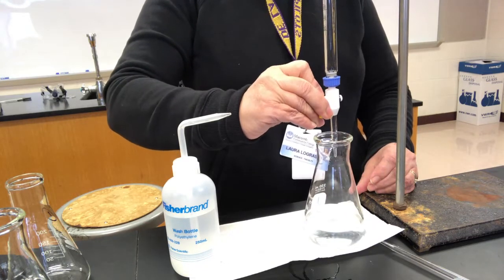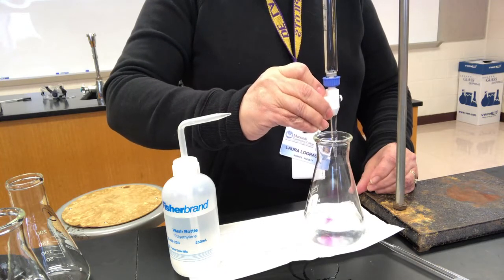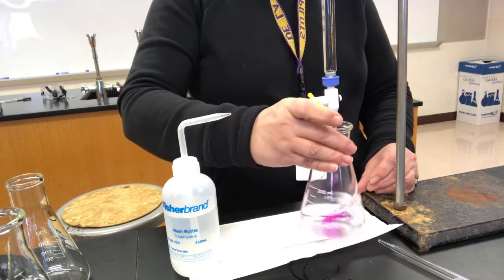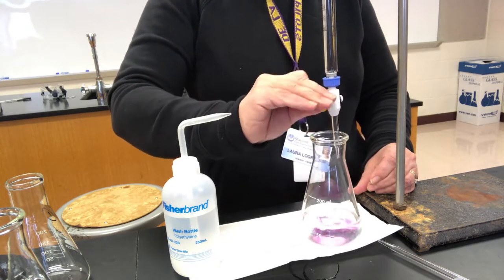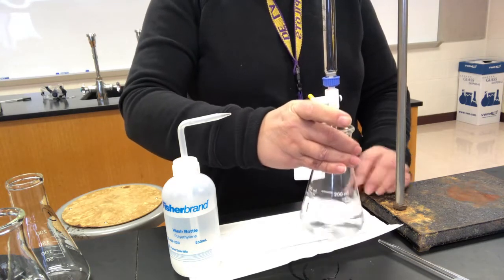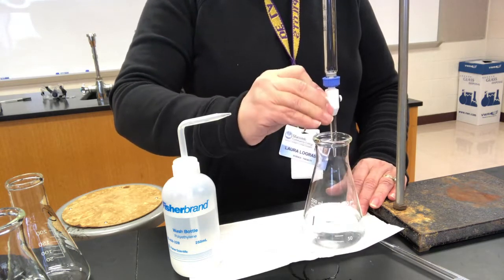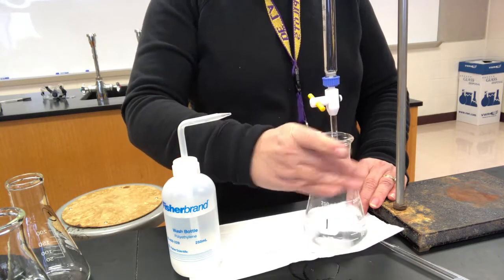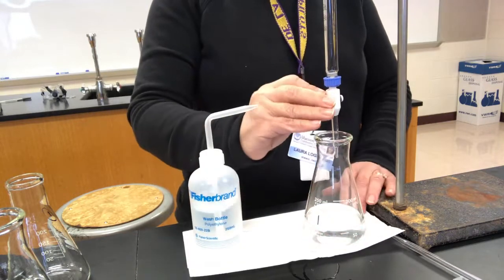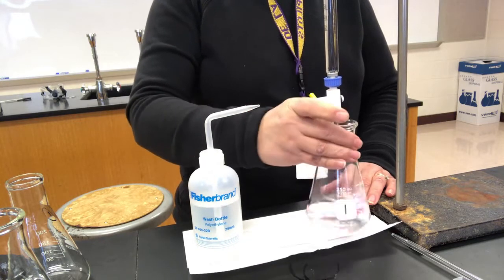Okay, so I might back it off a little bit here. This takes patience, which I don't have, but hopefully I'll have today, because your result's going to be my result. You want it to be good, right? Yeah, it's looking a little bit. So we'll just shorten the squirts, so you're not adding quite as much with each squirt. And then every so often, with a larger squirt like that, we'll want to rinse down the sides and make sure everything is looking good there.